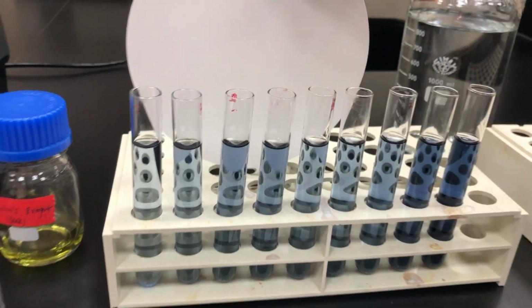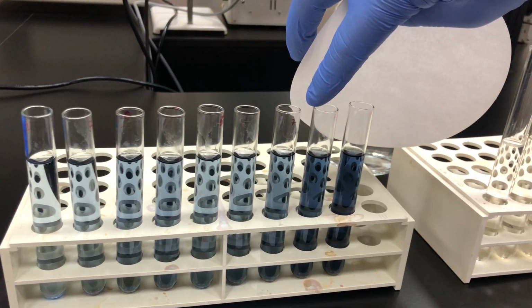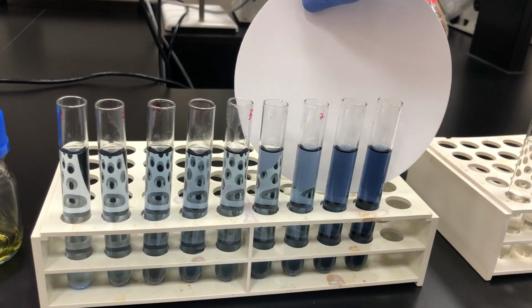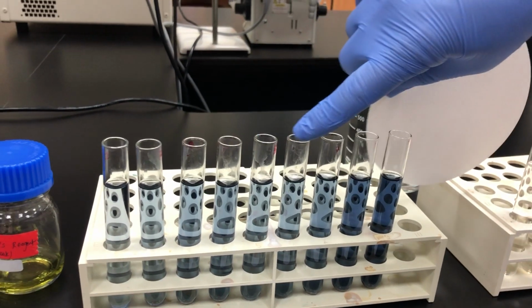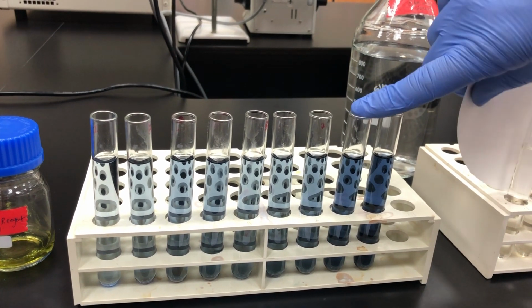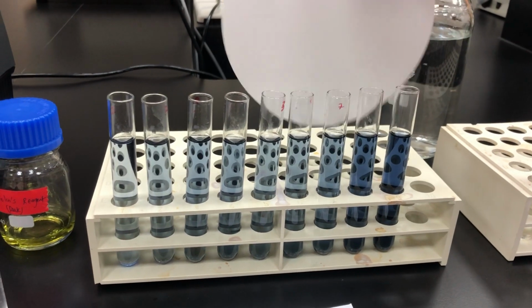Look, girls. The color starts to increase gradually until here, where it stops. That means here we reach Vmax. So now we have different concentrations of substrate. It increases enzyme activity until here, but here it becomes Vmax, meaning this is the maximum activity of our enzyme. So we need to prove this practically.